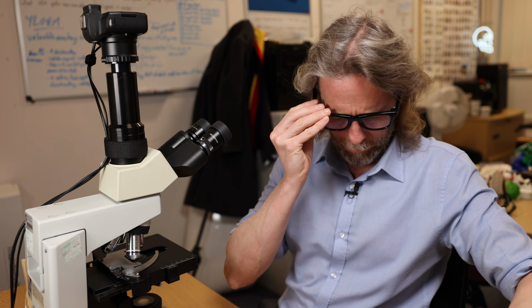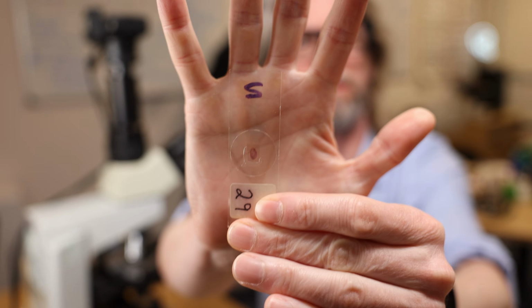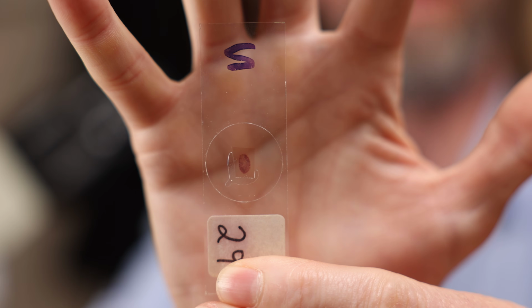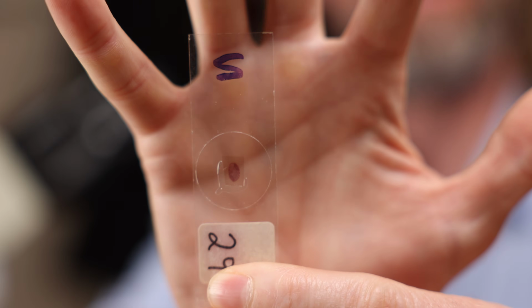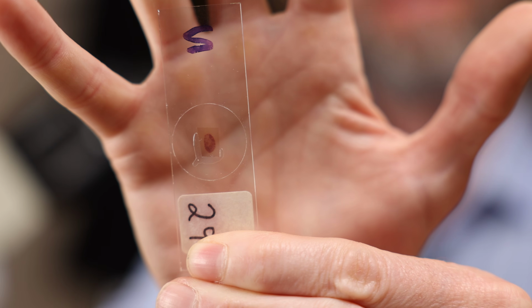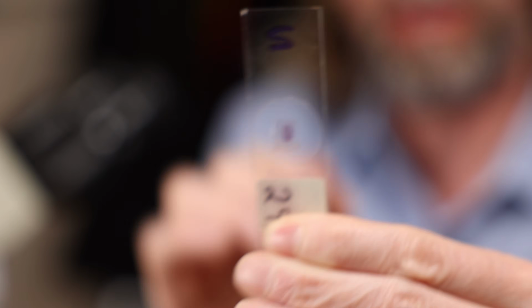Okay, let's see, what do we got? Looks quite nice. So lymph nodes can be a couple of millimeters to maybe say 20-25 millimeters in length. They're kind of bean shaped. We can already see how it's dark around the outside and lighter in the inside. We are already seeing a cortex and a medulla.